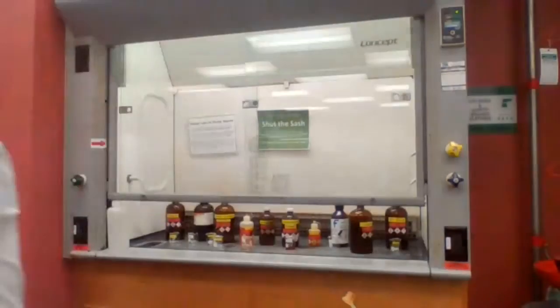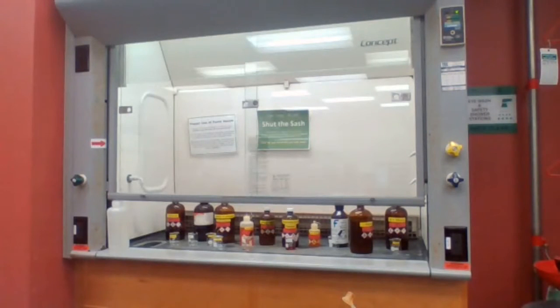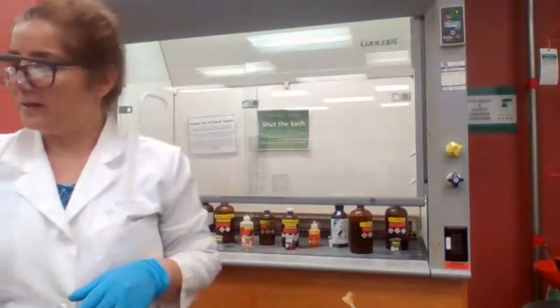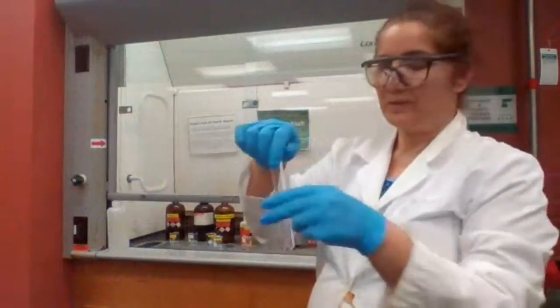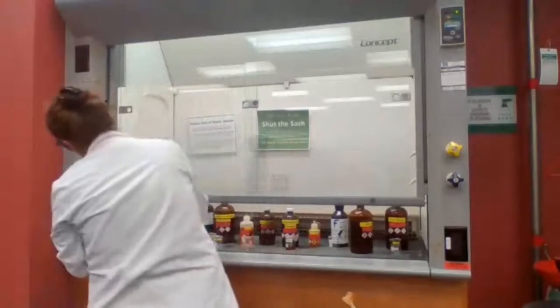Now, I'm going to repeat this test with the primary alcohol, and I want to see what would be the result with the primary alcohol.